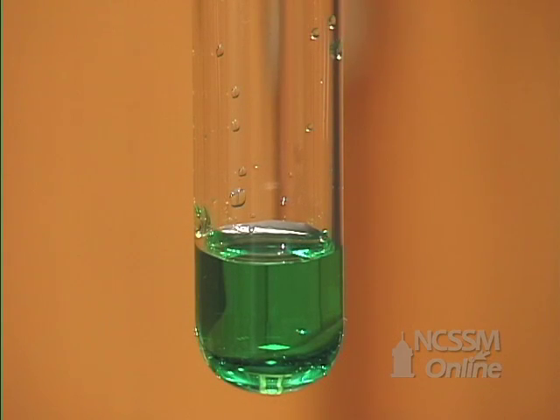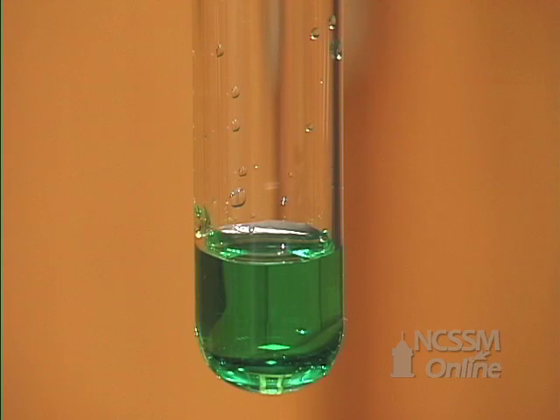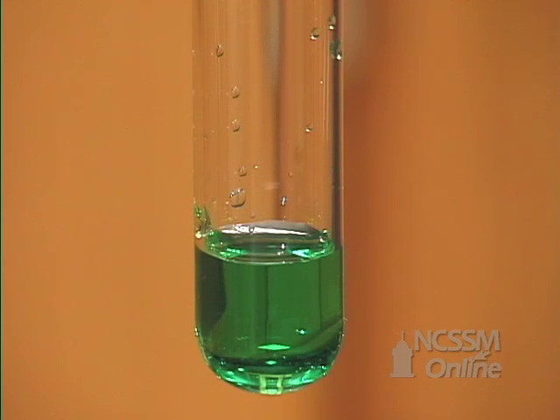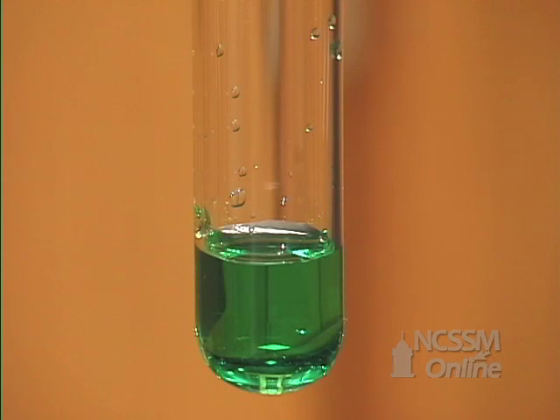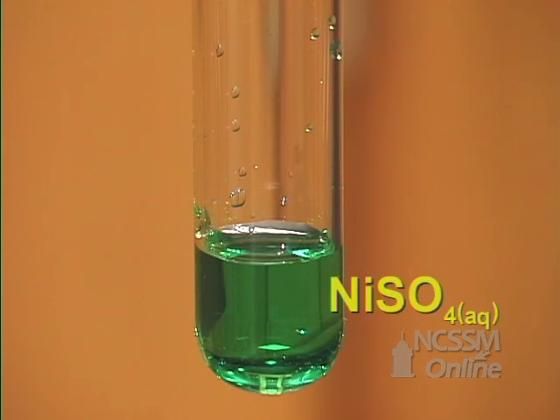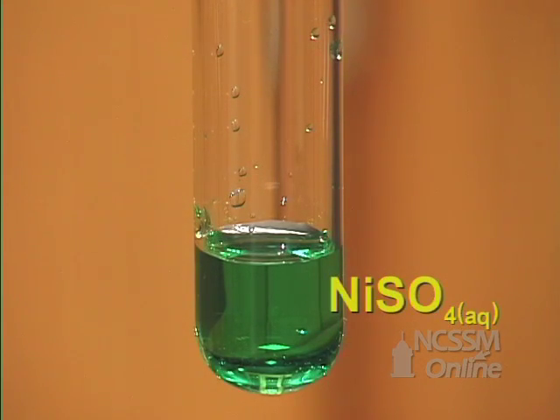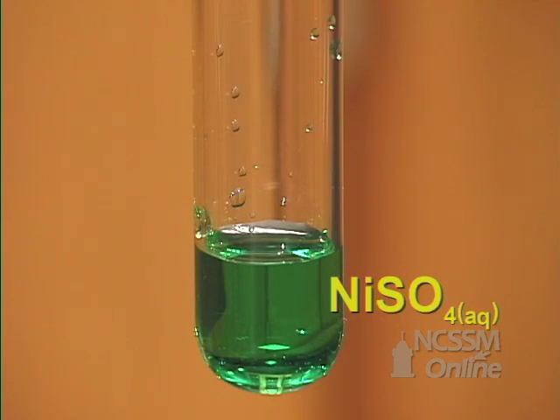We start out with a light green solution of nickel sulfate. We're going to add to it a clear solution of sodium chloride. When we add the sodium chloride to the nickel sulfate, we see that there's no precipitate formed.